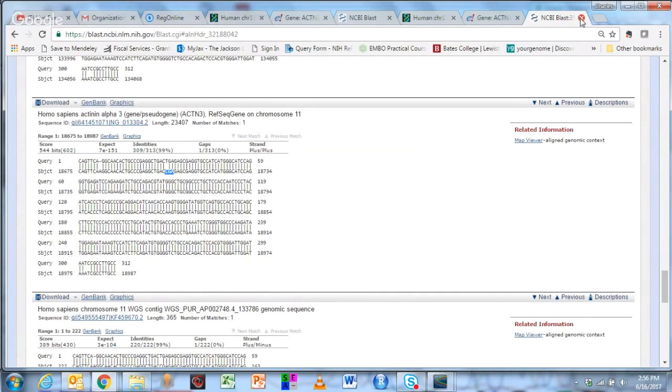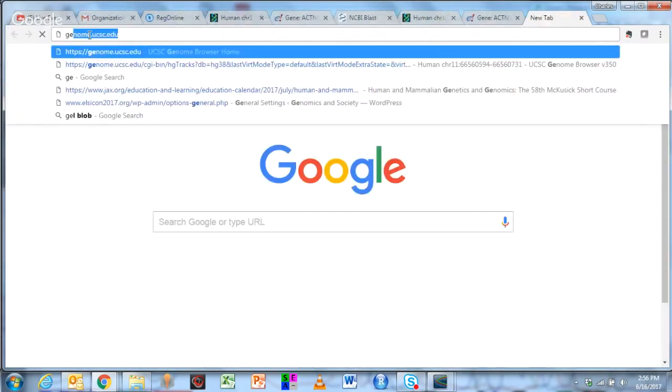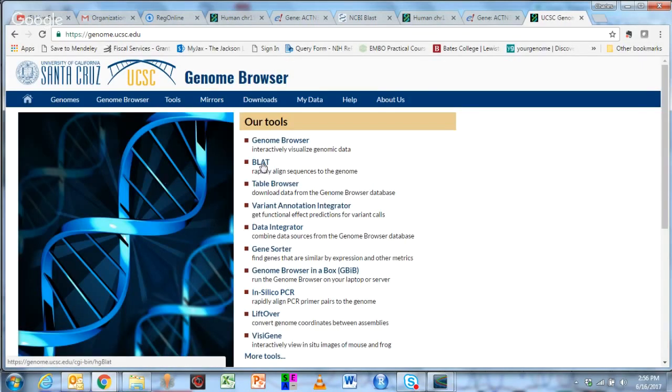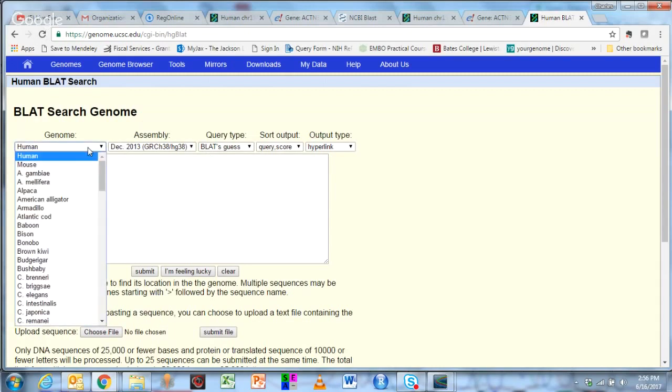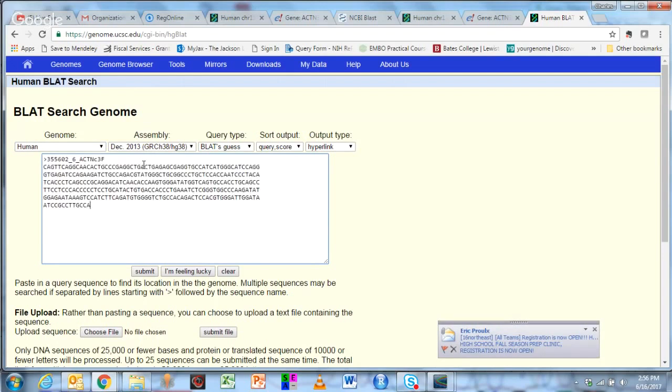So now we're going to go over to the Genome Browser at Santa Cruz, genome.ucsc.edu, and we're going to use a tool called BLAT, which is a BLAST-like alignment tool. But rather than going to a database, this aligns to a genome. It does ask you to know what genome you're working with. We're doing human here, and this is the most recent build. I'm going to copy and paste my sequence in here, and just for the purposes, I'm going to name it test actinin 3 and submit it.